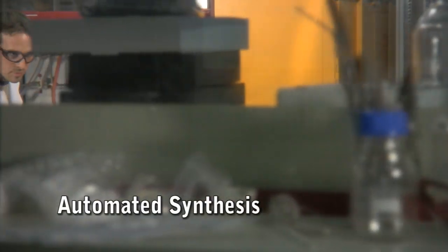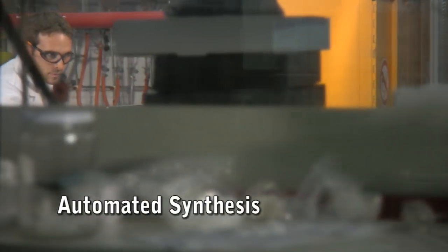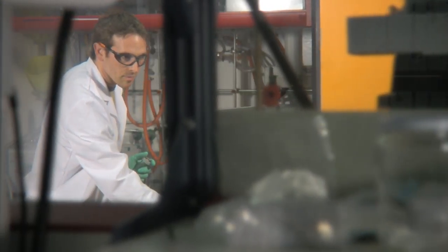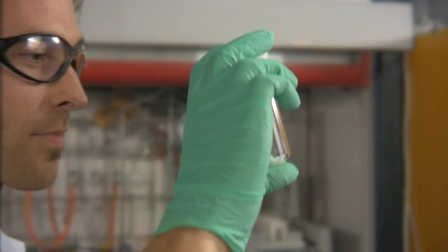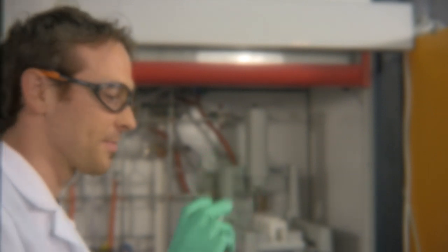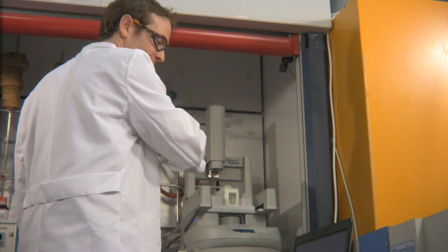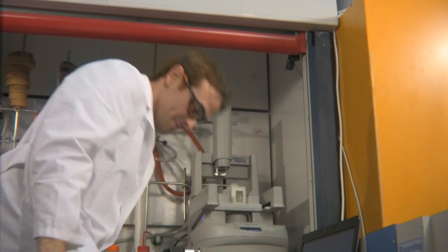In the centre of a fully remote controllable lab is an automated microwave synthesis reactor. Now cadmium selenide quantum dots are synthesised.